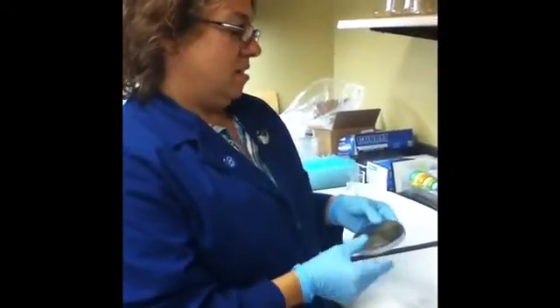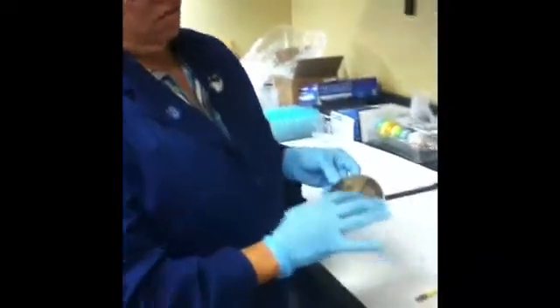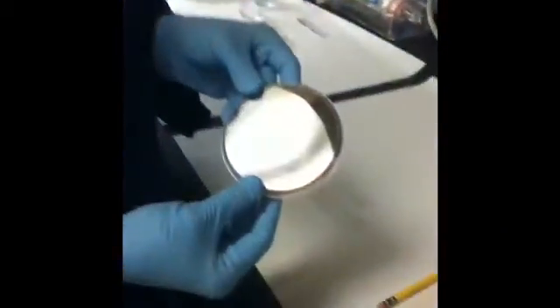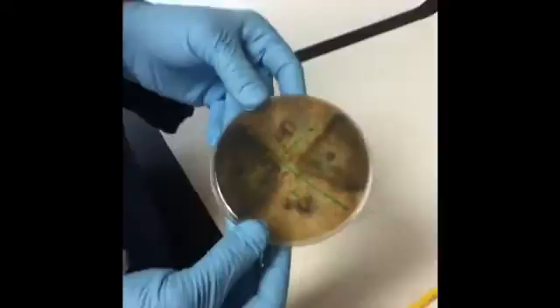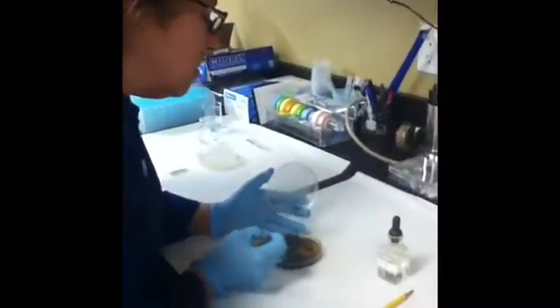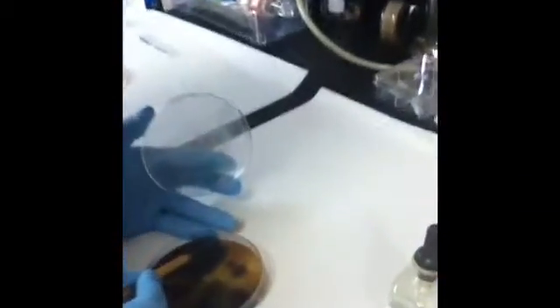This week we're going to notice how your zones are the way they were supposed to be, and then we're going to take a sample of the perithecium and observe the asci and the ascospore under the microscope.